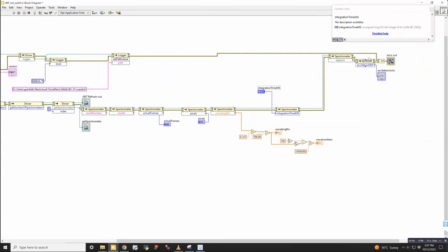And then excitation nanometers, this tells you the wavelength that it thinks is being used for excitation. Yeah. And this one's 785. Yes. For the default integration time, can we go lower than 100? Yeah, you would just have to change that.